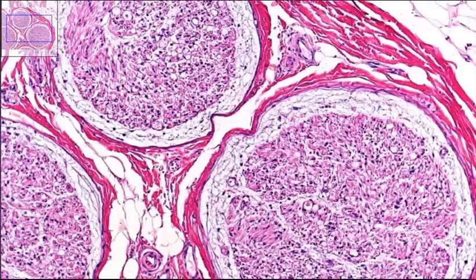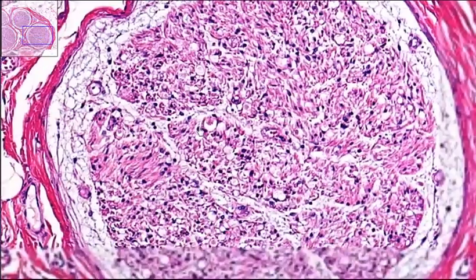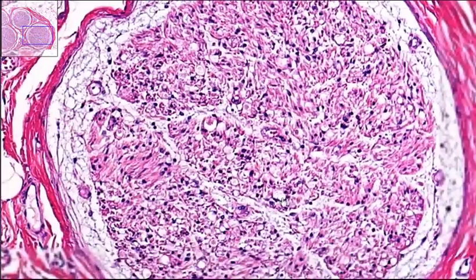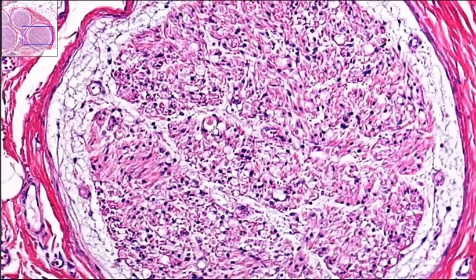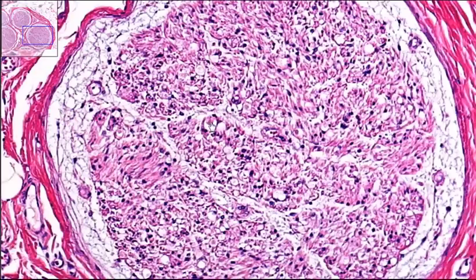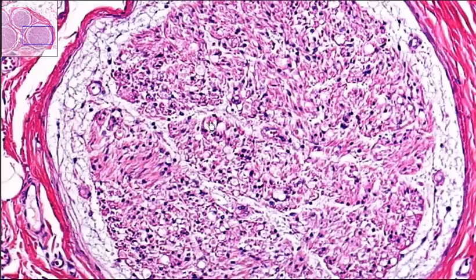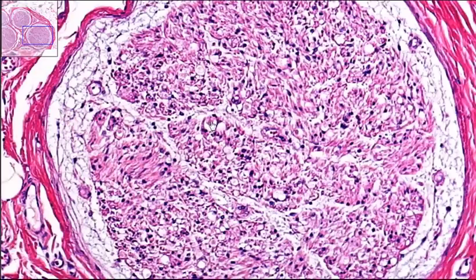Now if we zoom in, we can see the inside of the fascicle. Right here, at the tip of the pointer of the mouse, you can see a purple cross-section, which is going to be the cross-section through an axon.